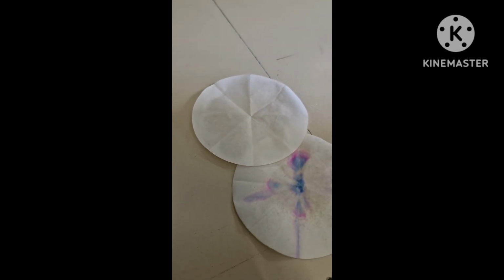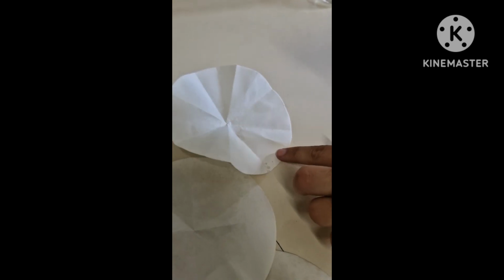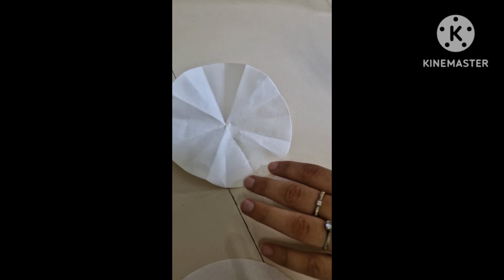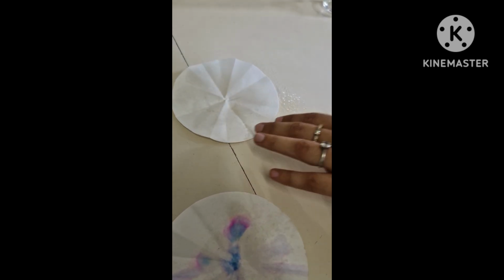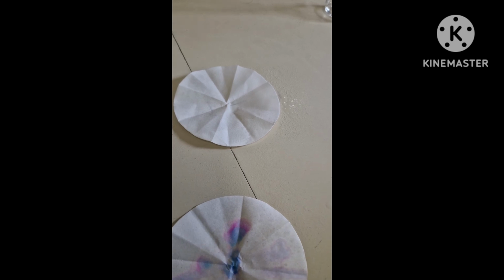After that, if the spots do not appear, like if you take any amino acid sample, you need to put ninhydrin spray. Fine, thank you. You can use an iodine chamber along with that universal visualizer. That is also a classical example to visualize the spots.